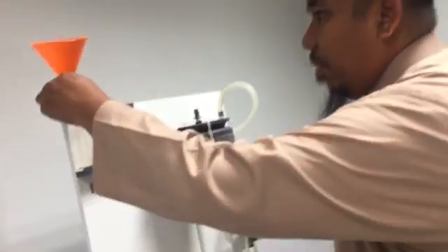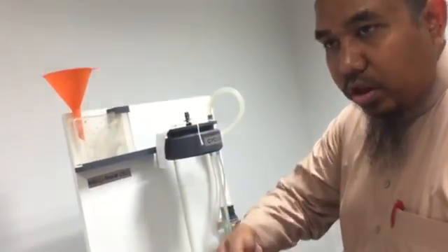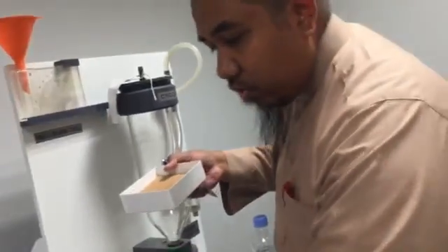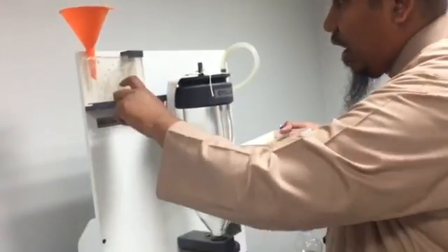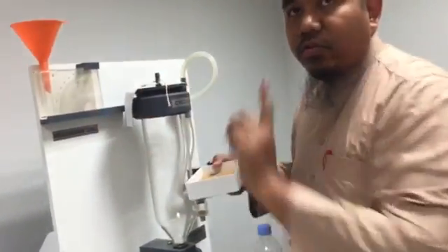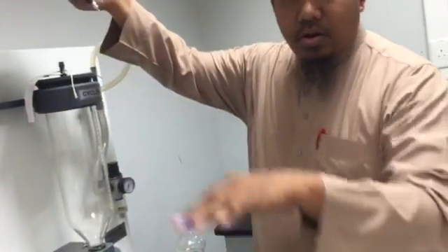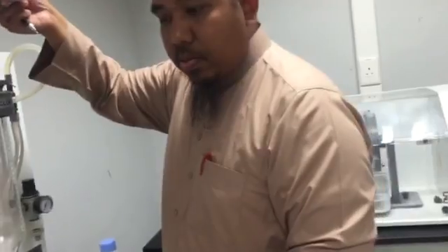Because you put the samples, and let's say this is your sample that you get from there with different size, okay? Because we want to see the effect of the size of the particle on the angle of repose. This is one. We take the sample from 3 different sizes, and 3 experiments. You choose whatever.